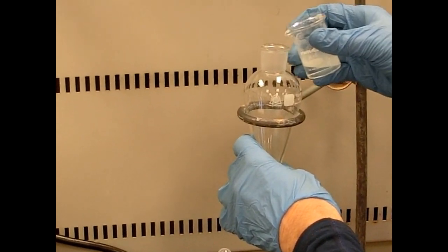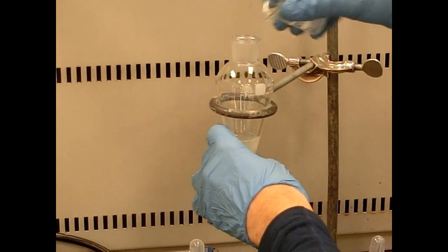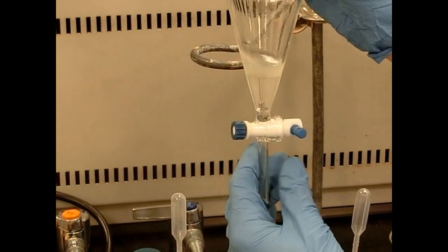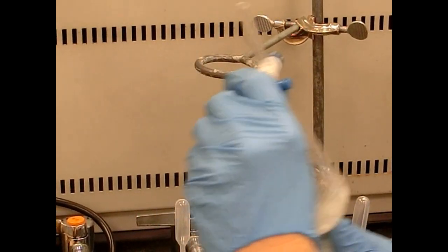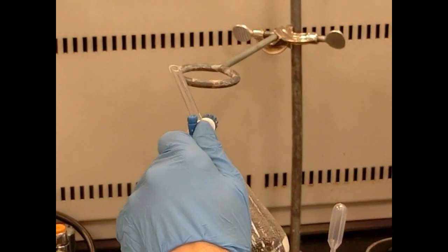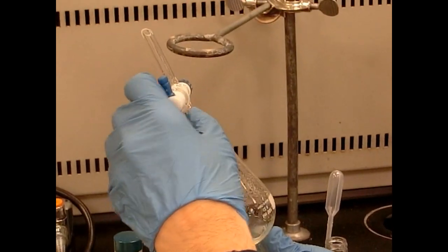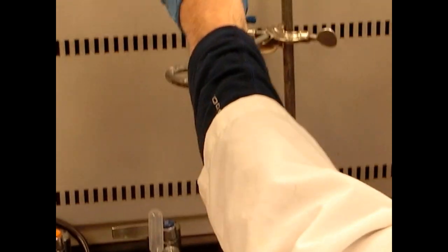I'll pour this in. See our two layers separating nicely. Sometimes it's actually okay to do one more little shake and stir to make sure that everything goes into the right layer. Always want to vent, especially with ether, to vent off the pressure buildup of the ether. Let's set this back.